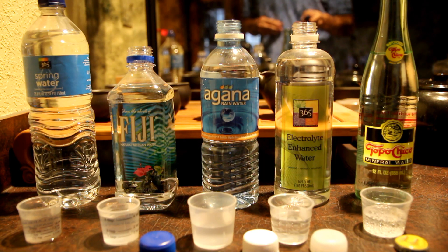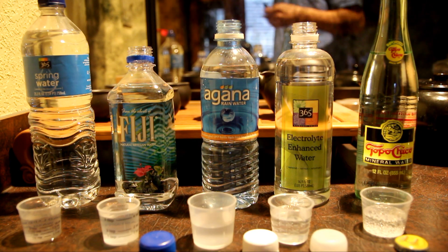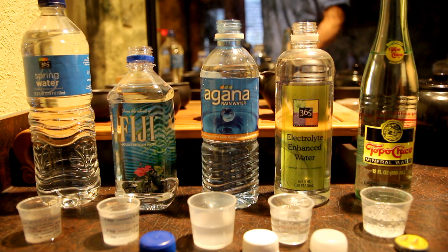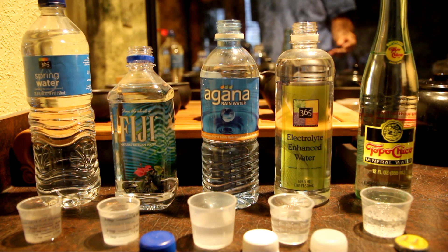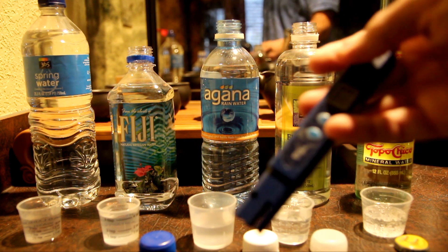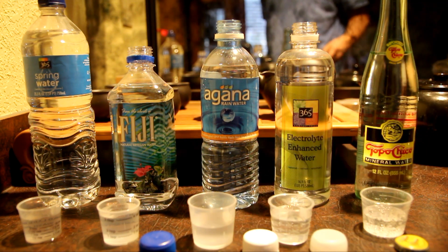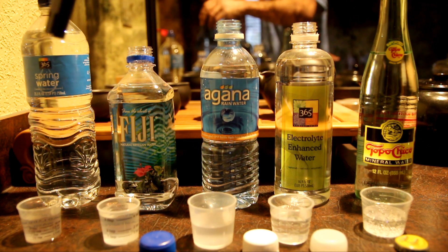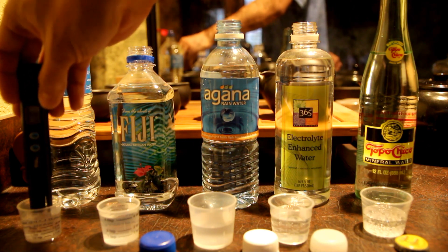I'm curious what the readings of everything else are. So I open them all up, pour them into these small little containers, and in between measurements I'm going to rinse off the tip of my TDS meter with reverse osmosis filtered water. So first let's look at spring water.